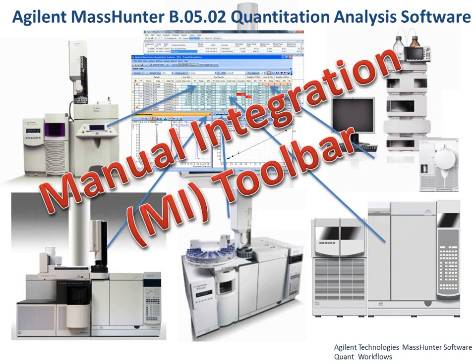And yes, there are situations that require manual integration when you don't have the chromatographic separation. Many compounds in a run. You could get bunching, peaks on a sloping baseline that the integrator isn't able to identify, partially resolved isobaric compounds, the Achilles heel of mass spec, isobaric compounds, and then you've got the whole array of humpograms and blobograms, all to be dealt with by manual integration.